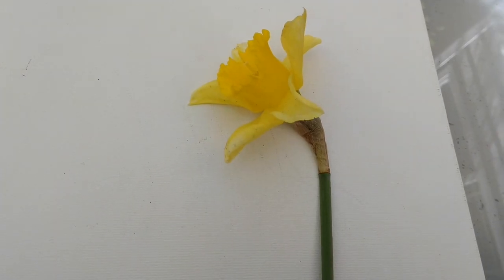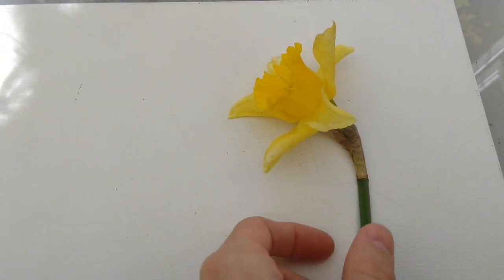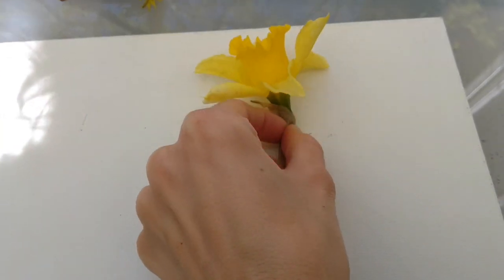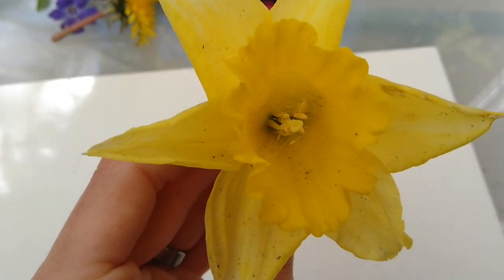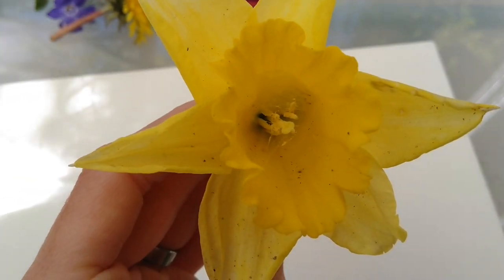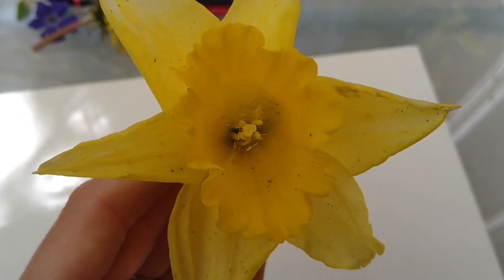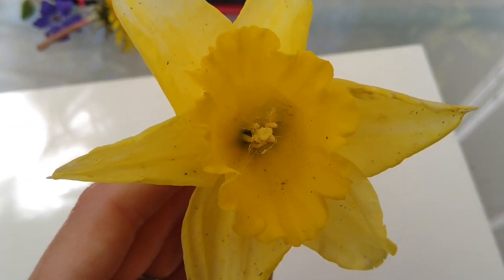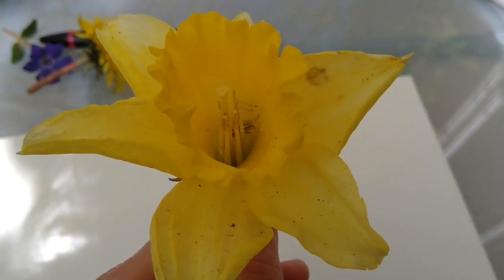the inside. I realized when I was looking closer at this daffodil, it actually has somebody living inside of it that I'm going to have to find a new home for. I wonder if you can see them. It has a little bit of spider web, and it has a little spider waiting in there. I'm sharing this because that spider is very smart. Can you see its legs?